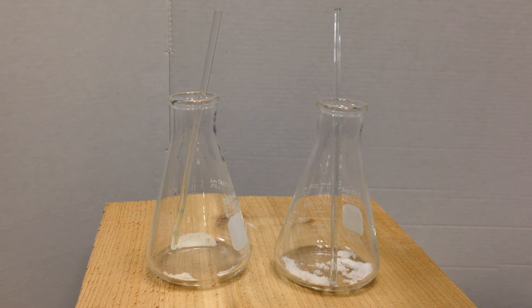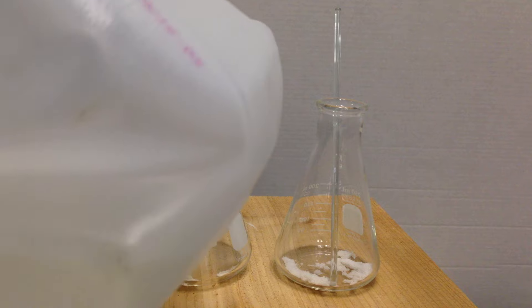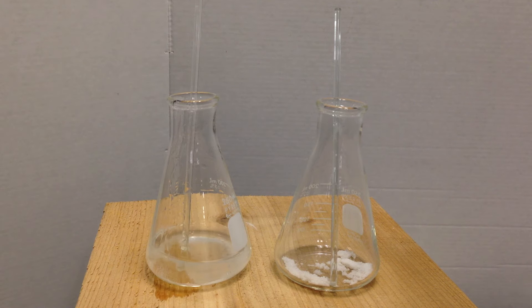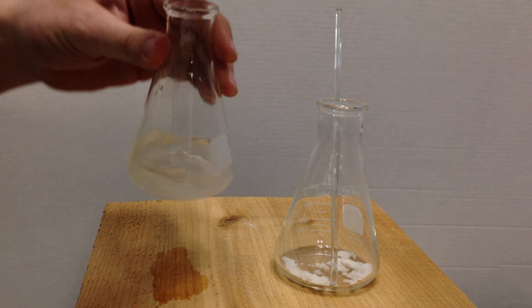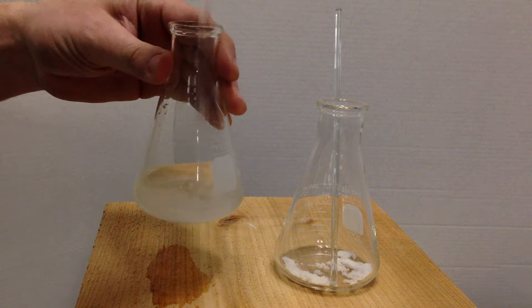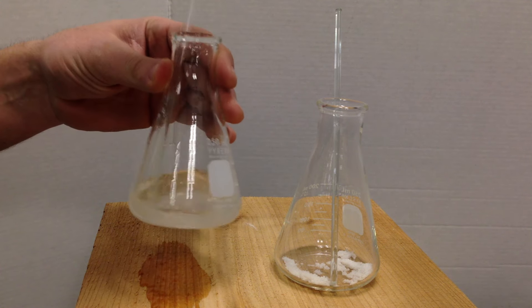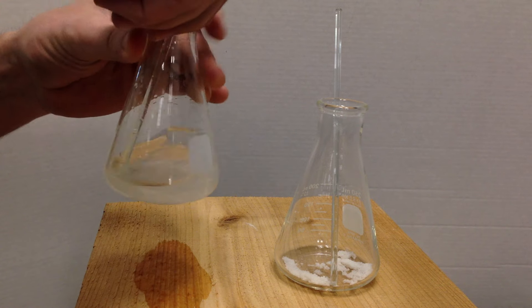I'm going to make a solution, an aqueous solution with these. So I'm going to make aqueous lead nitrate here. Mixing, you can see that it makes a solution and it does dissolve. It is definitely aqueous.